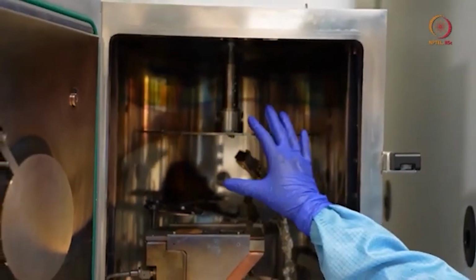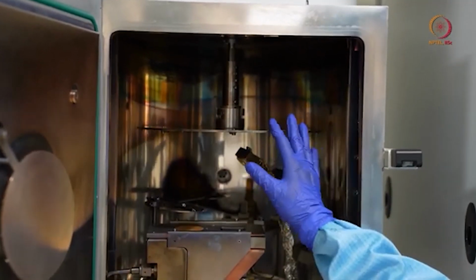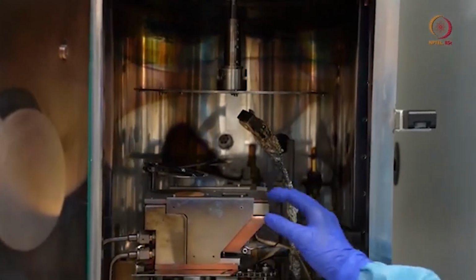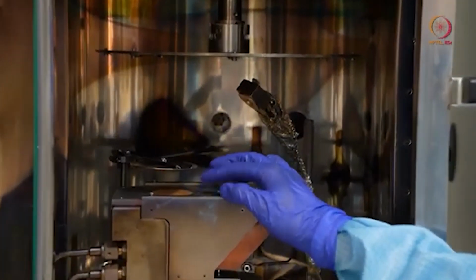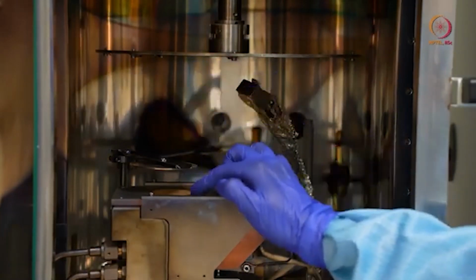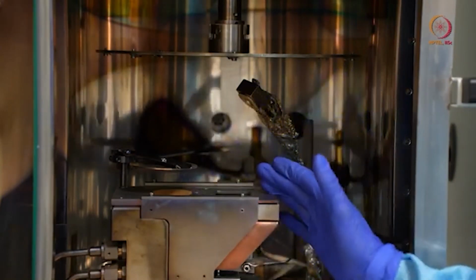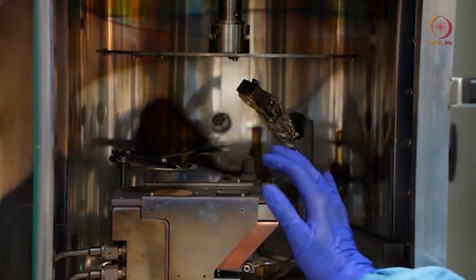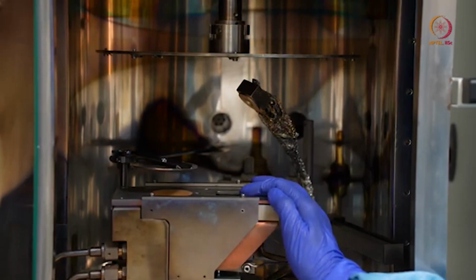Today we will show you first the stationary deposition, and then deposition in rotation at the same vacuum level only. As I told already, I will be showing stationary first. For stationary deposition, the sample should always be exactly above the source, so that deposition will be maximum. If it is in rotation, then you don't have to worry, because the whole chuck will be rotated, and in rotation uniformity is always better. So we prefer deposition in rotation always.